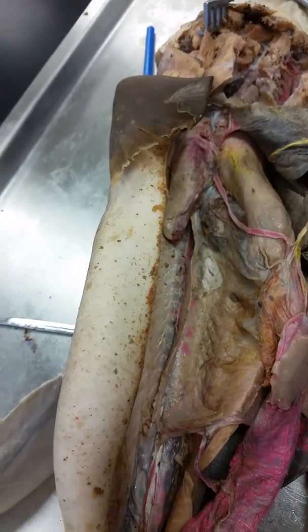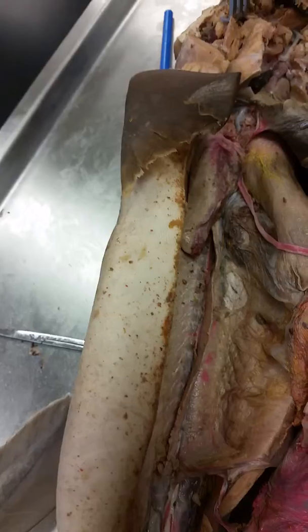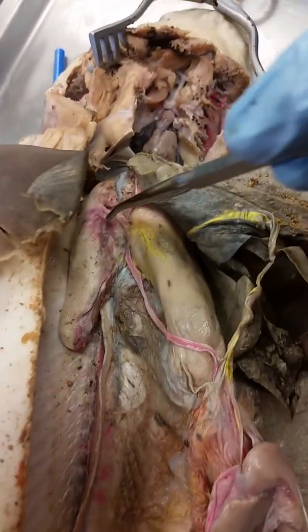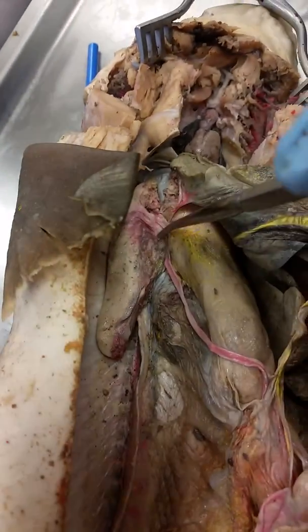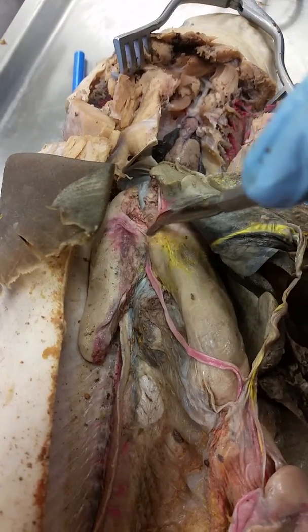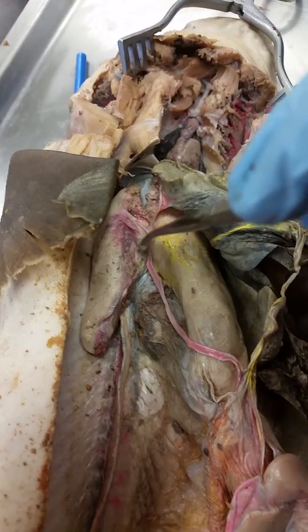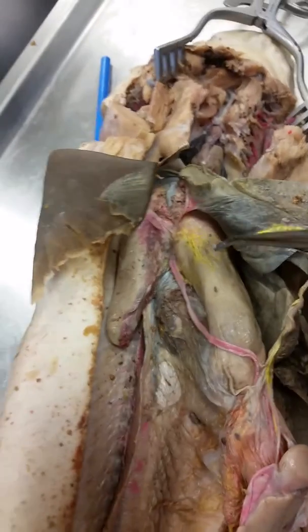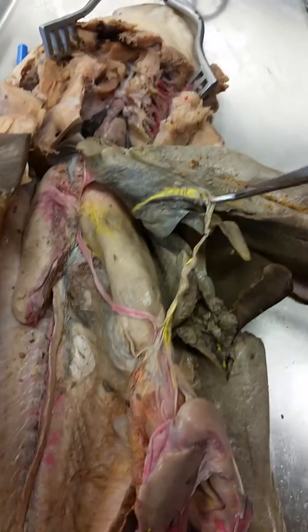The testicular artery is right here, and then it meets up with the celiac right there. The gastro-hepatic artery is in this mesentery bundle by the hepatic portal vein.